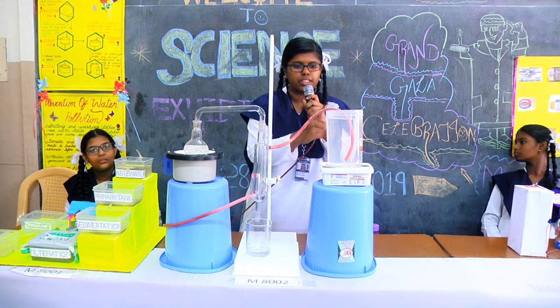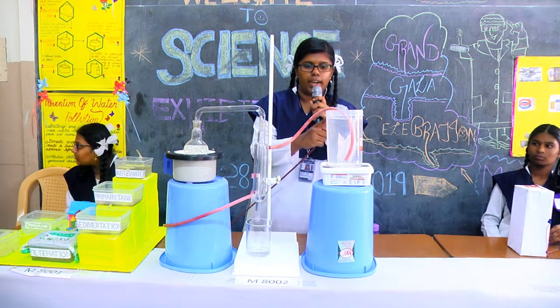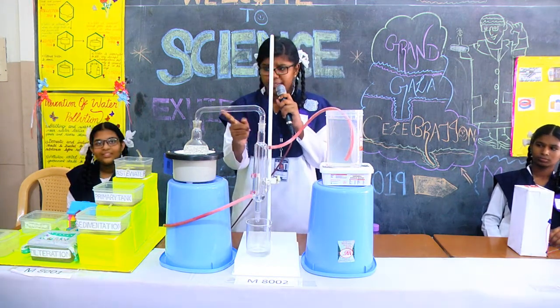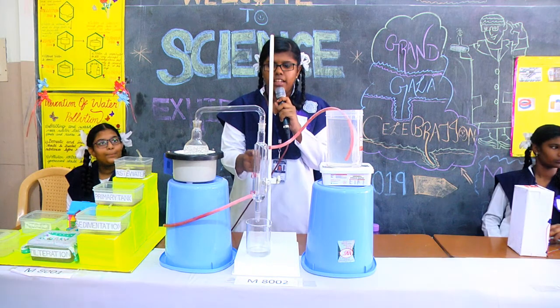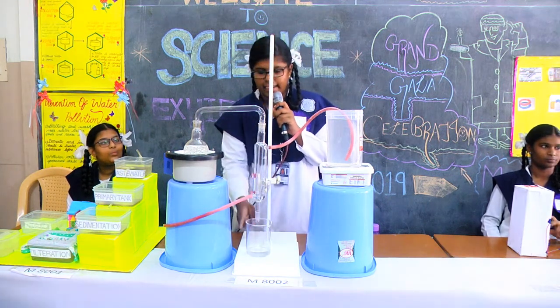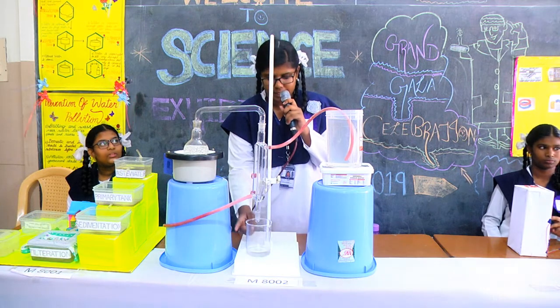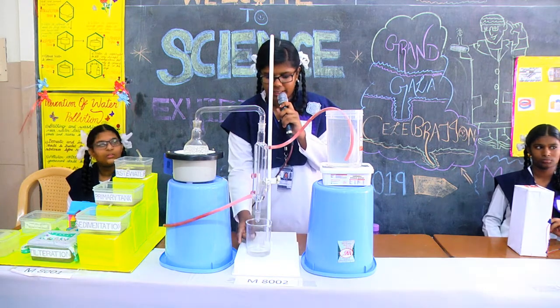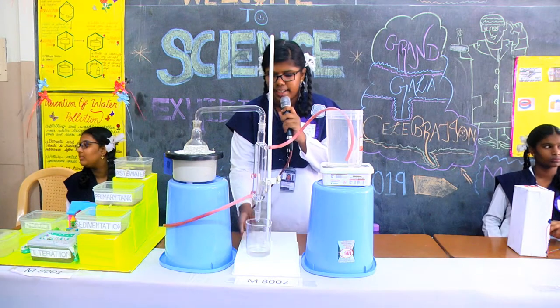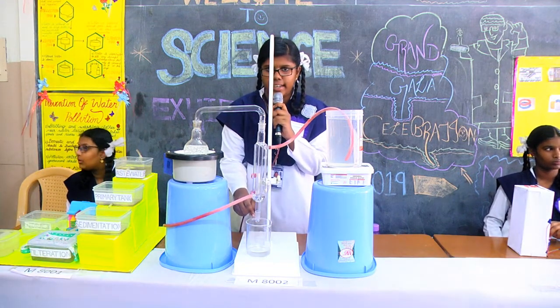I have connected this inlet to this bucket which consists of cool water. When the vapour passes through this condenser, the vapour turns into liquid and it is collected in this beaker, which is known as a receiver. This water collected here is known as distilled water.